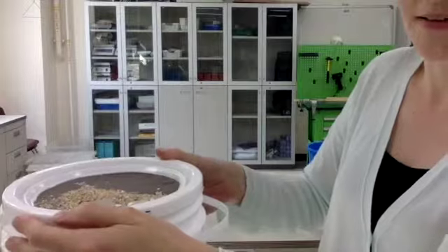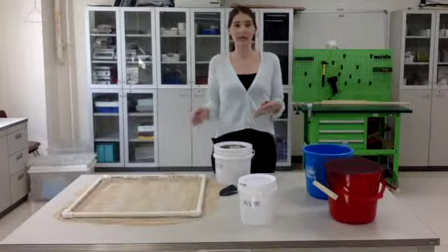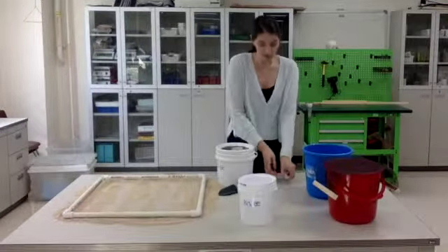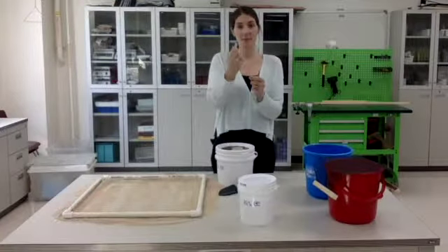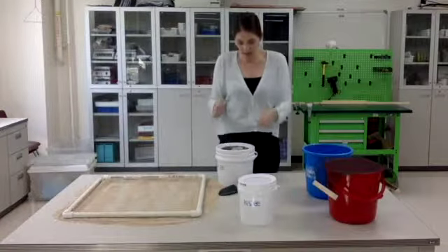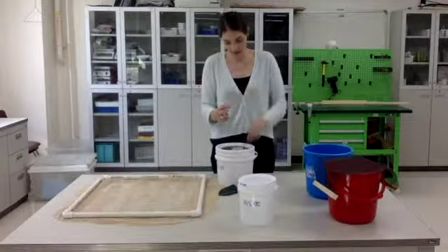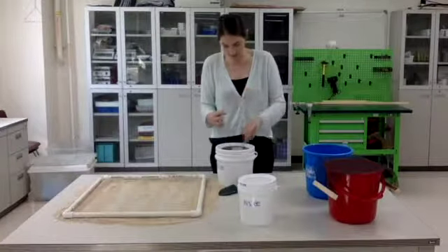So let's go ahead and collect it. There's a lot of plastic in here because I actually made this sand so that it was full of microplastics, and I may have overdone it. So the first thing I want to do is, for my sample site number 1, find my little micro tube, and start picking out pieces that I can actually see. So I can see these pieces, and I'm going to pick them out.